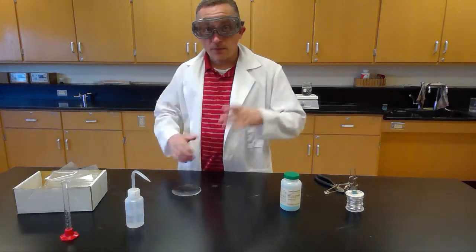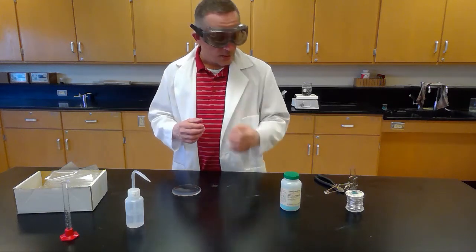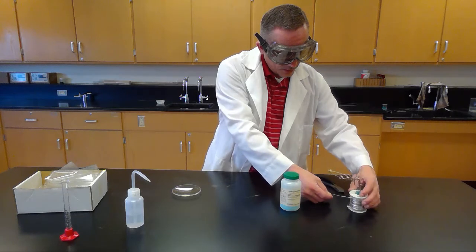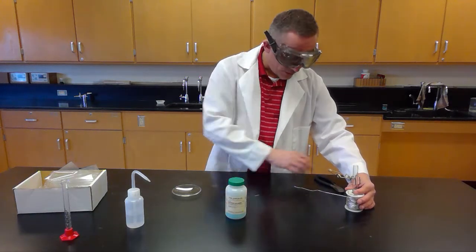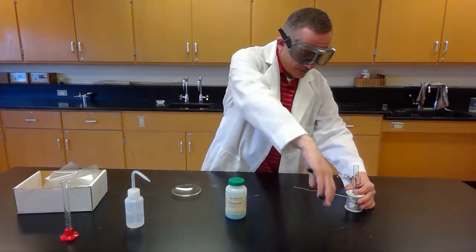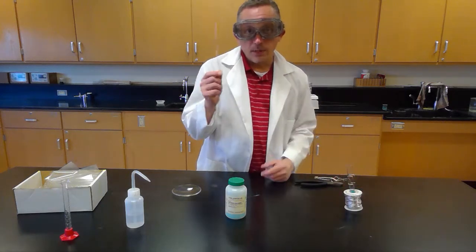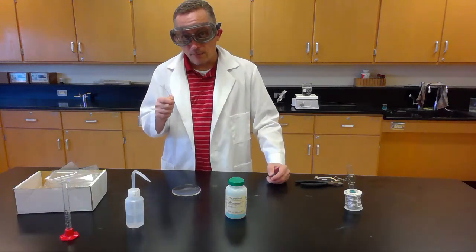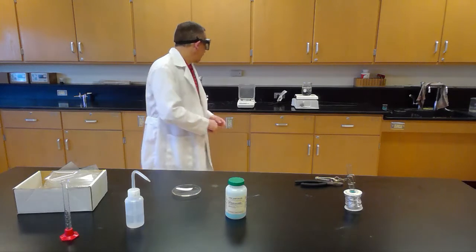It also wants us to find a length of aluminum wire. So I'm going to get a little length of aluminum wire here. It says on the instruction, I believe this is about 16 centimeters. It doesn't really matter exactly. Just make it about as long as your hand. So I'm going to take my wire cutters and cut that off. And we are going to want to measure its mass. We're going to want to put it on the scale and figure out how many grams before we do anything with this. So I'm going to do that right now.